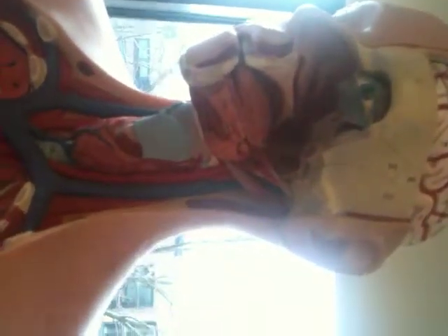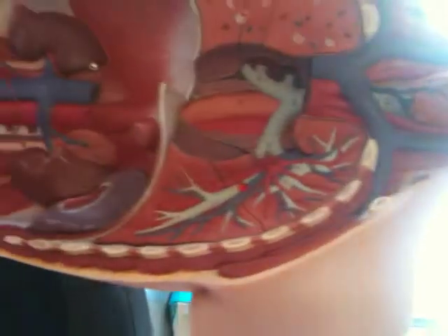Show me the maxillary. Will you point at it again? Maxillary coming right here. And then the one that goes... this would be probably external, and this would be internal? Well, it depends on where it's going. It just looks like this one goes internally. This one is actually still the common carotid, and then one part goes into the brain, and then one part comes up here and becomes the superficial temporal.